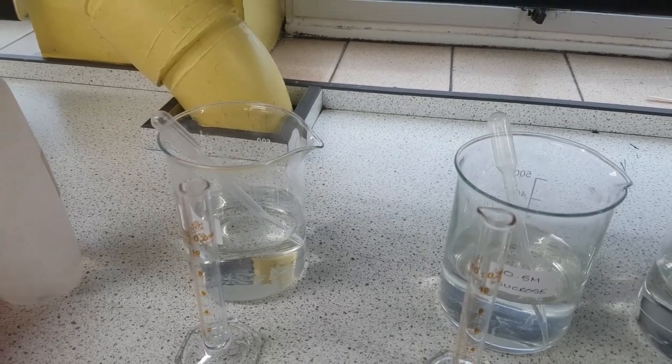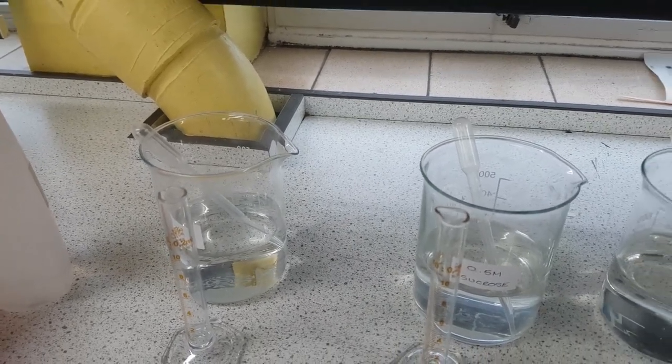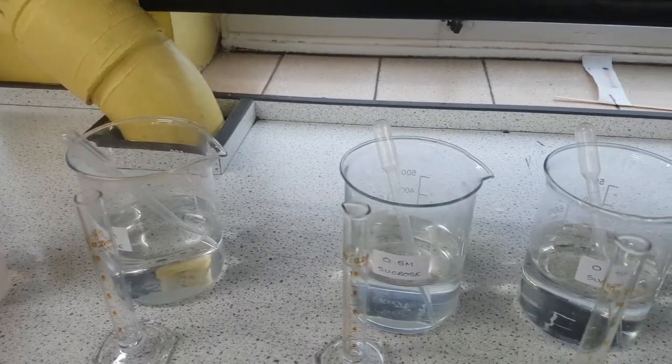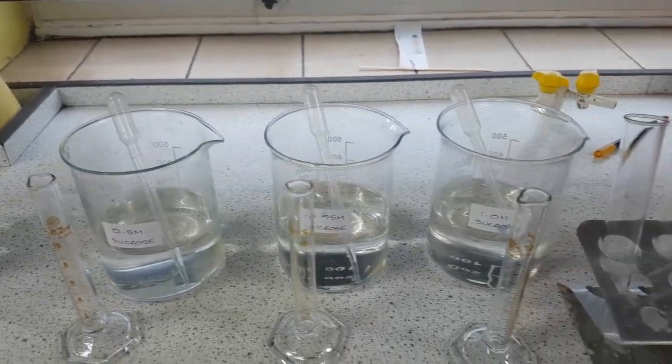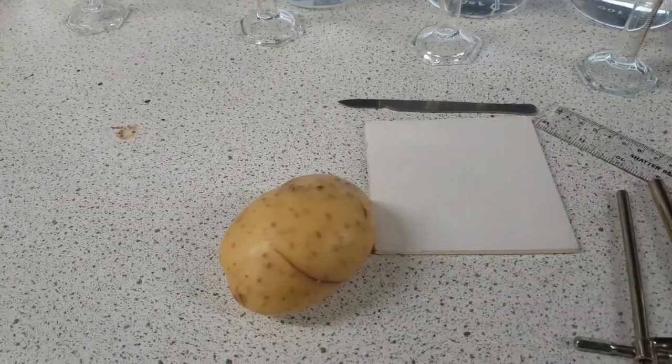Now you've got to make sure that you avoid contamination, so there will be 5 stations and keep the pipettes within their respective stations and do not move them about.